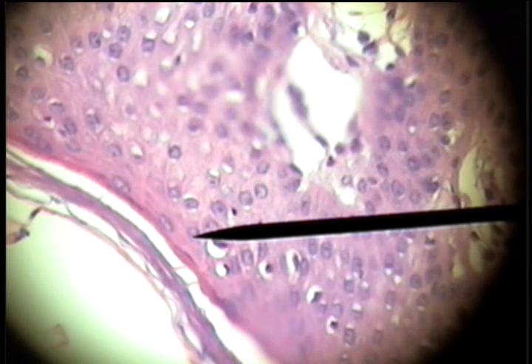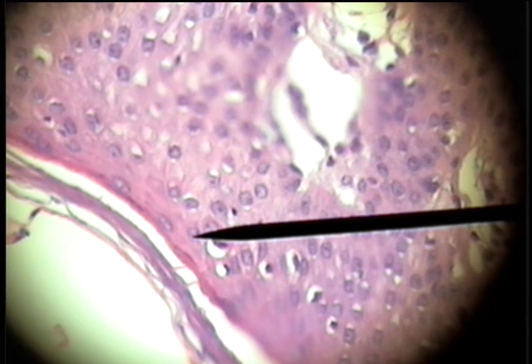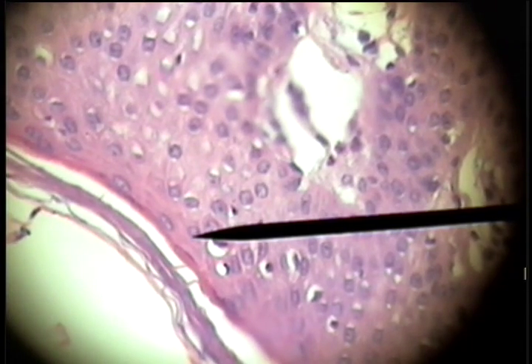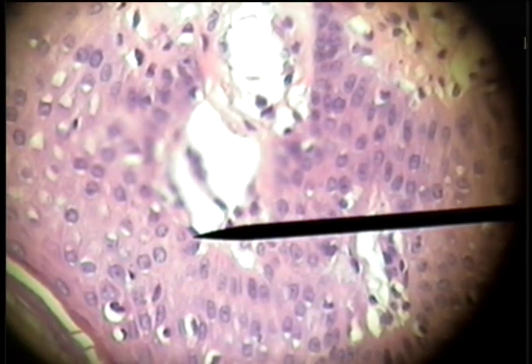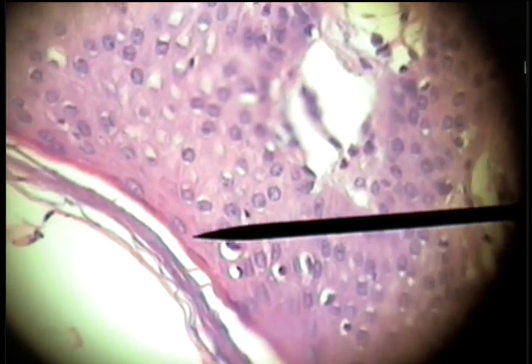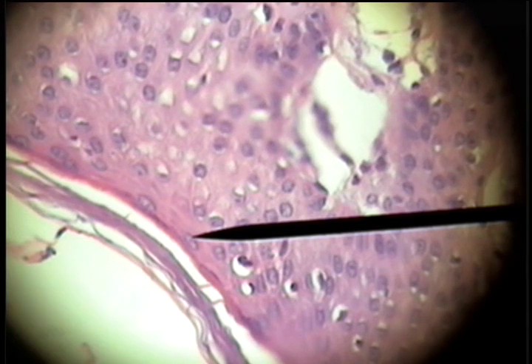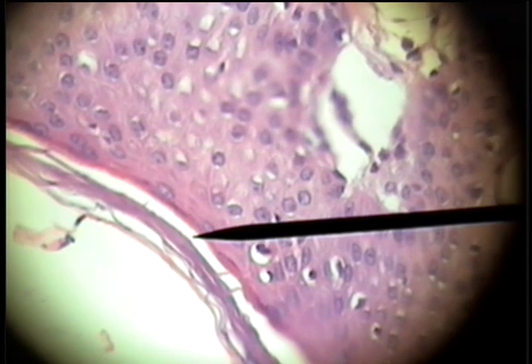There is a stratified squamous keratinized epithelium. It's found in the skin, and the keratin represents protein structures that remain when the cell dies. An example is thin skin, and here's skin with the lower cell layers of different shapes, and as they reach the surface, they are stratified squamous — that is, they're flattened and there's a layer or two — and then exterior to that is the keratin.